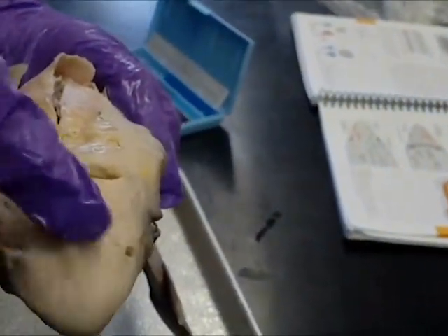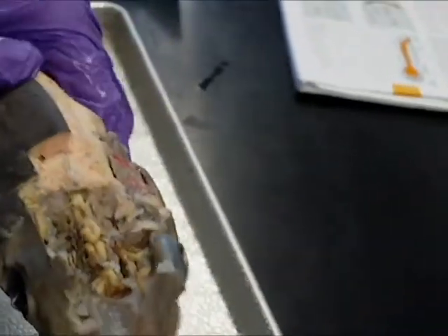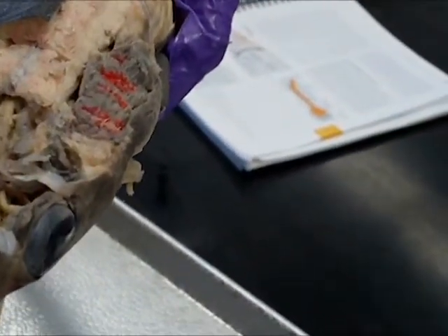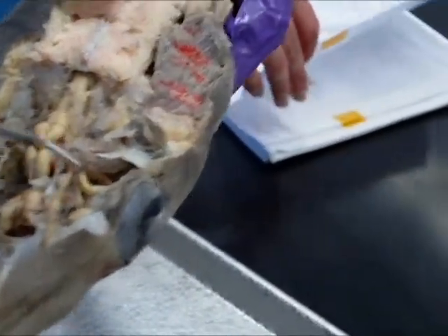Up front are the ampullae of Lorenzini — the small pores that excrete gel when squeezed. And naturally, the eye. We have the eye muscles right in here. We have the dorsal oblique, and underneath that would be the ventral oblique.